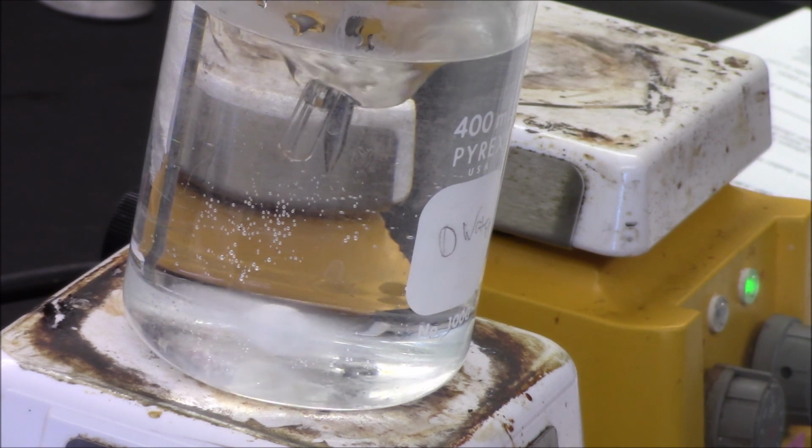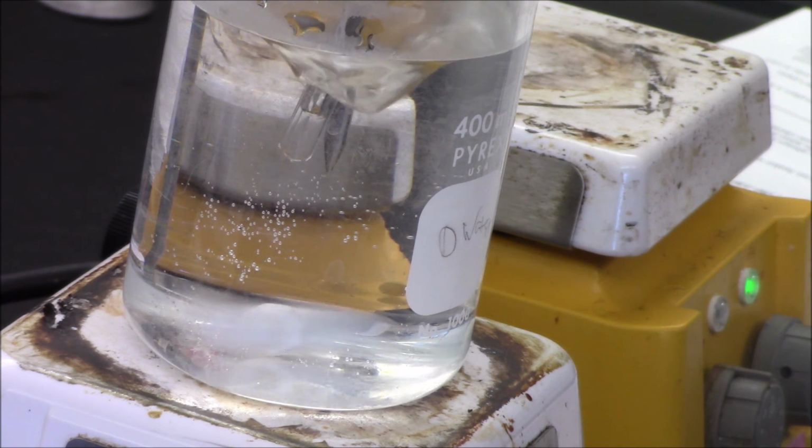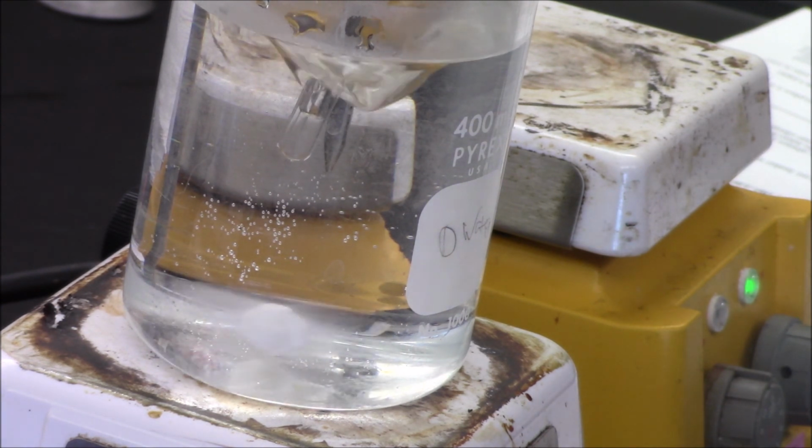52.0. It stopped. That's amazing. I can't even believe that just happened. 52.0, guys. What can I say? I'm pretty good at what I do.